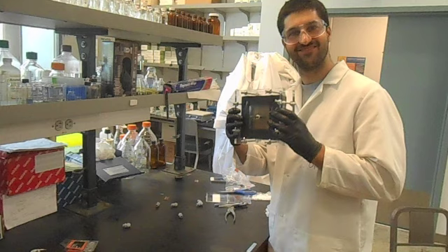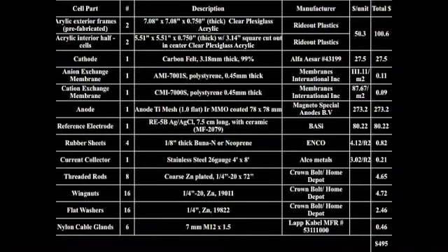And there you have an electrochemical cell. Here is a list of the parts used in constructing our reactor, for a total cost of about $500 per cell. Feel free to contact either William or James with any further questions.